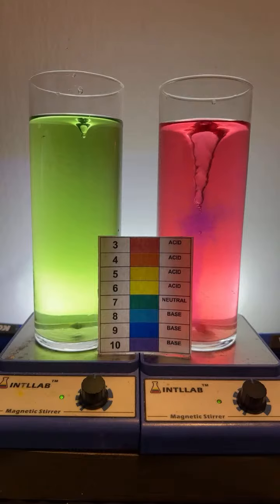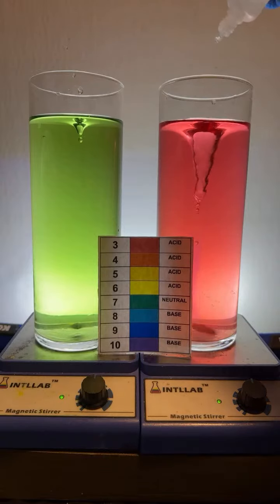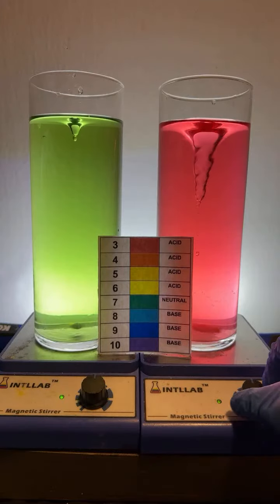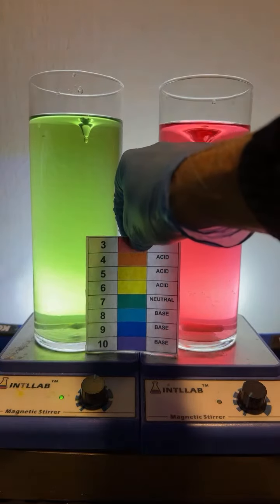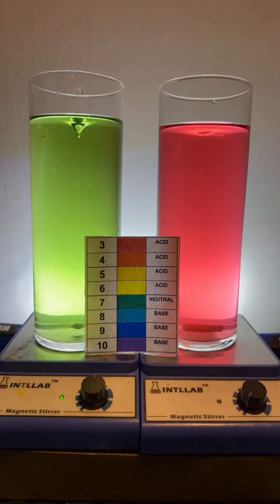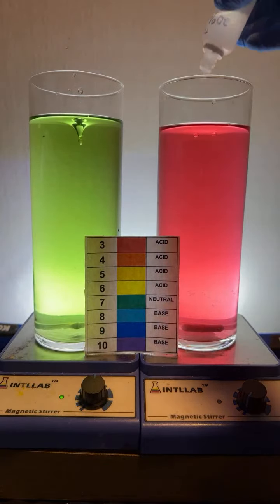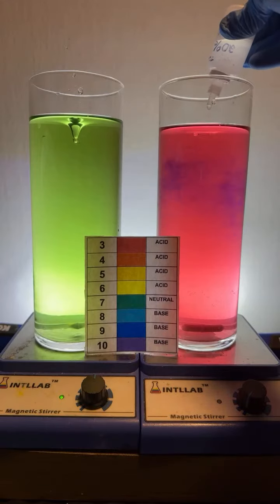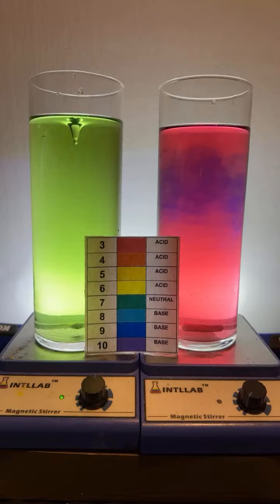All right, let's make this one. Someone wants the rainbow. We're going to try it. Let's get this one over here very acidic. We're going to try to make the rainbow. Now I'm going to turn this stir bar off, and now I'm going to add a bunch of base here. Here we go. We're just going to add, I don't know, let's see what happens over there. Random. I cannot do pink.